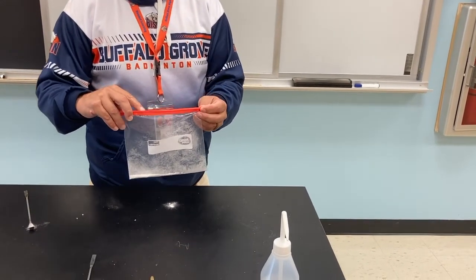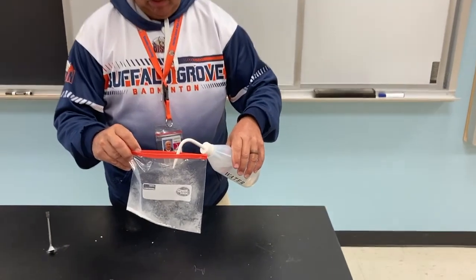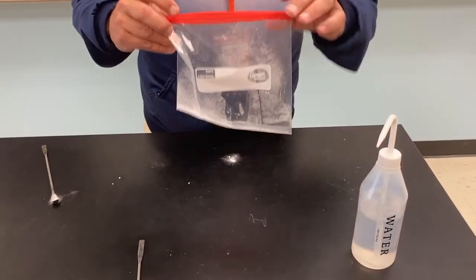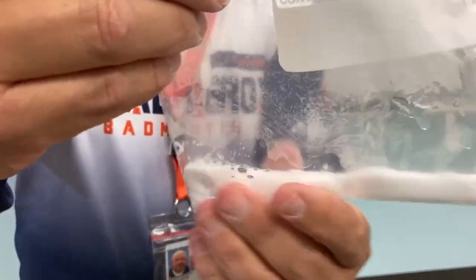All right. Beautiful. All right. So now we got these guys together. Ooh. Oh, what? You can even hear it. It's definitely fizzing.